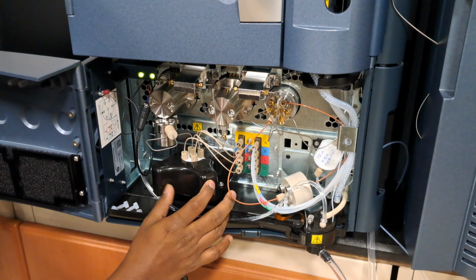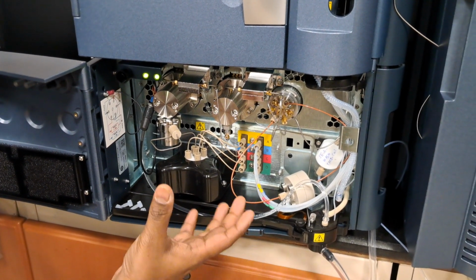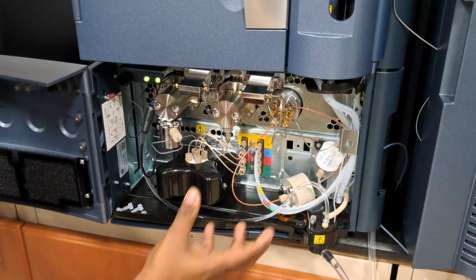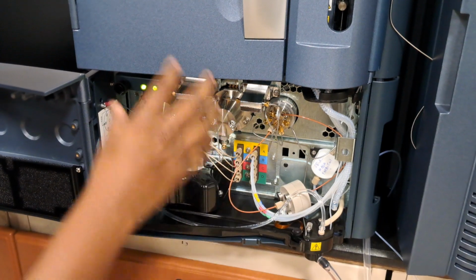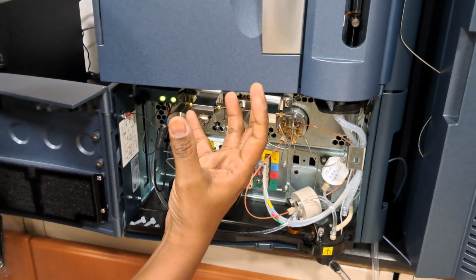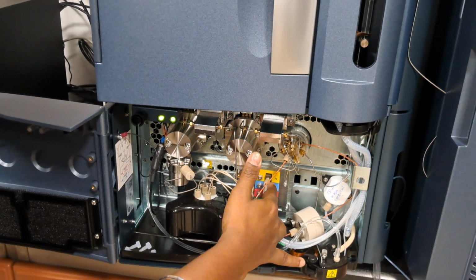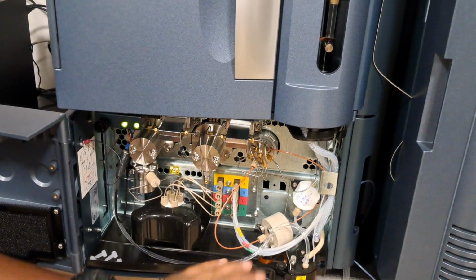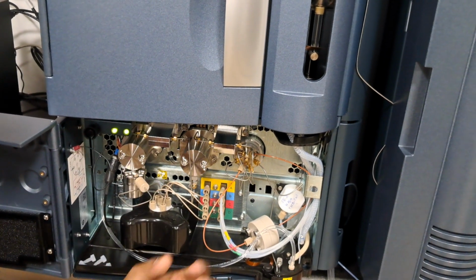From the top side, it is coming by gravity flow. Then it is called low pressure mixing. We are not pumping from the top side actually. Usually the flow will automatically come and sit in the degasser chamber. Whenever we want the flow, that time we will be pumping. So the main idea is it has to come by gravity. If there is any airlock, when we give priming, the pump sucks the flow and takes out the air bubble.